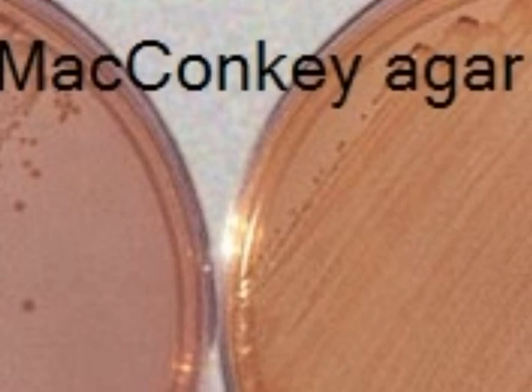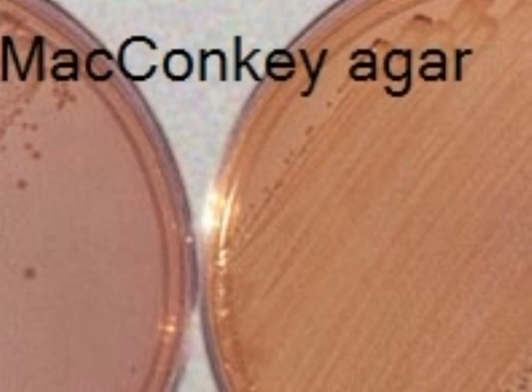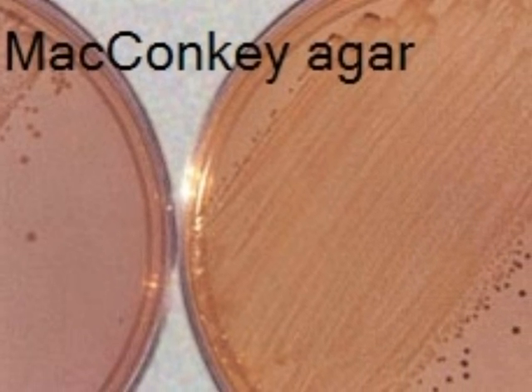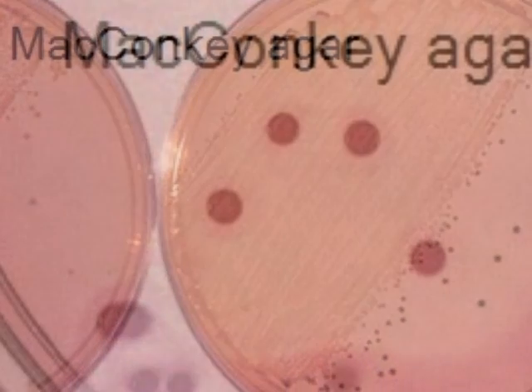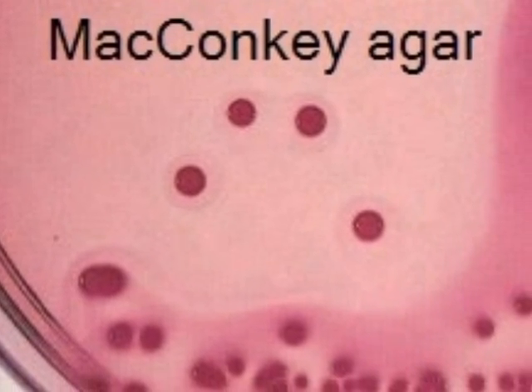Here are 2 examples of good growth of non-fermenters. Your interpretation would be, microbe tolerates crystal violet and bile salts, does not ferment lactose, and is most likely a non-coliform. In this example, you should observe bright pink or even red colonies.